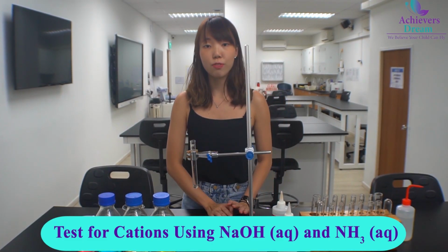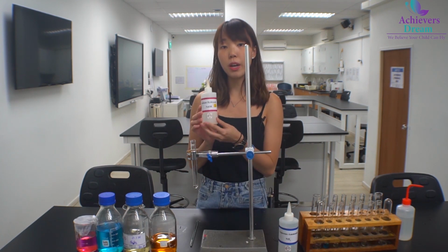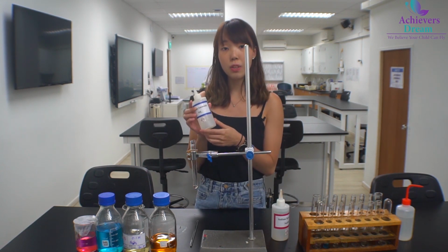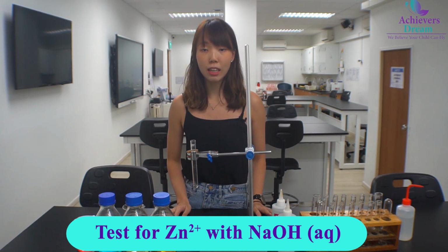Today we'll be doing the test for cations. There are two ways to test for cations. The first way is to add in aqueous sodium hydroxide, and another method is to add in aqueous ammonia. So first up, we'll be doing the test for the presence of zinc ions.